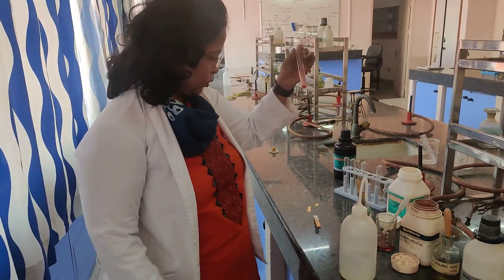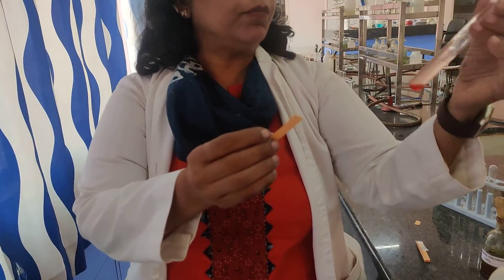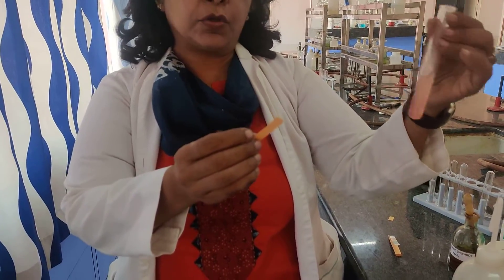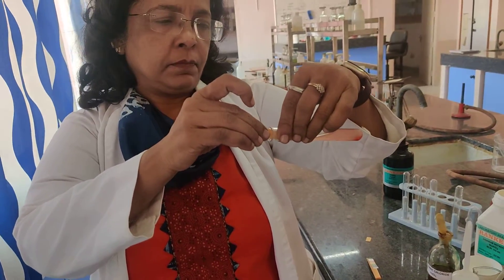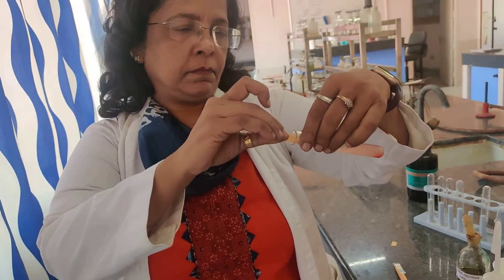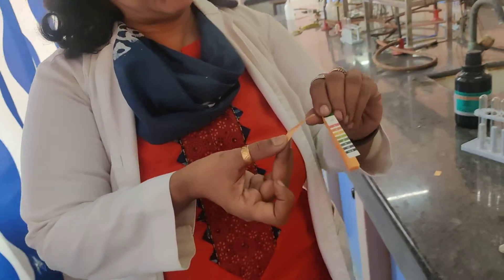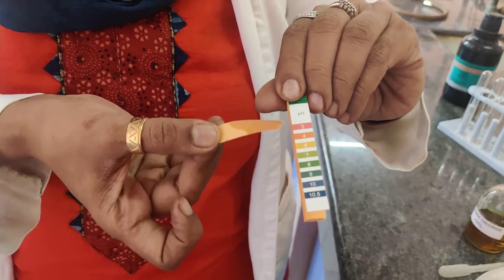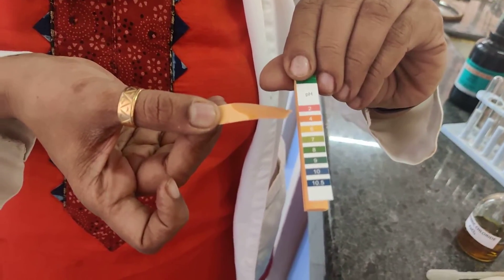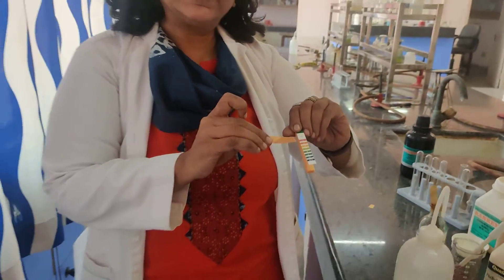The next thing you need to do is check the response to pH. A pH paper is peach in colour. When you put the pH paper into an aqueous solution of phenol and observe the colour change, the pH paper remains peach, which matches a pH of somewhere between 4 and 6. This clearly shows that phenol is acidic, and hence phenol is said to be an acidic functional group.